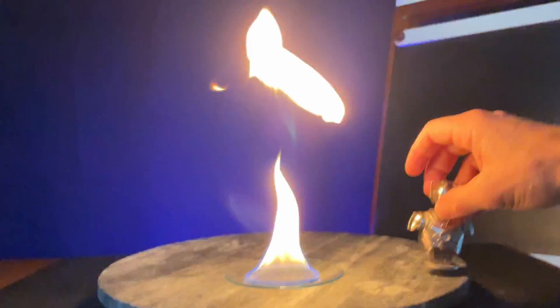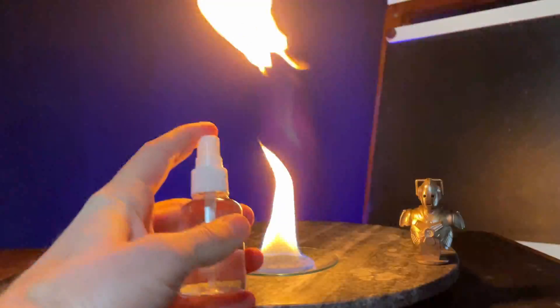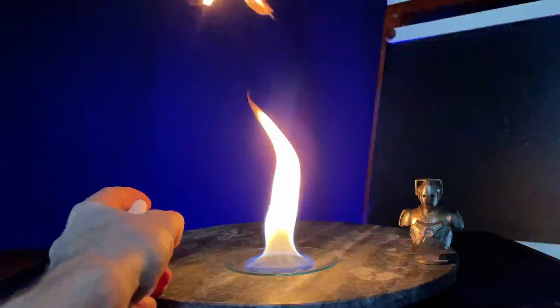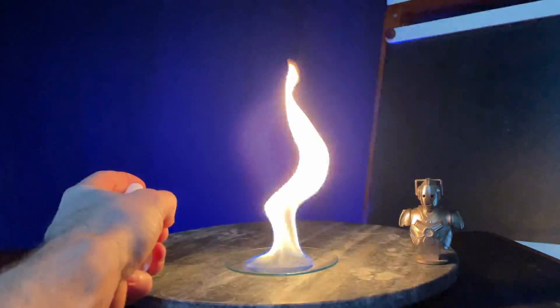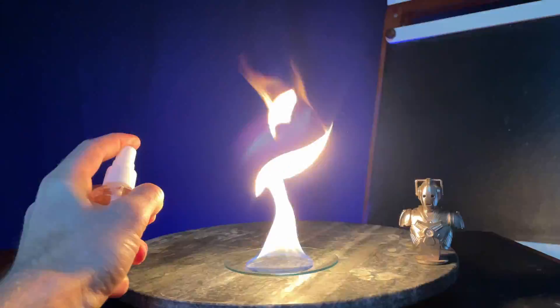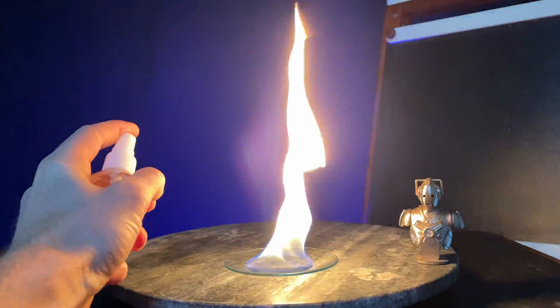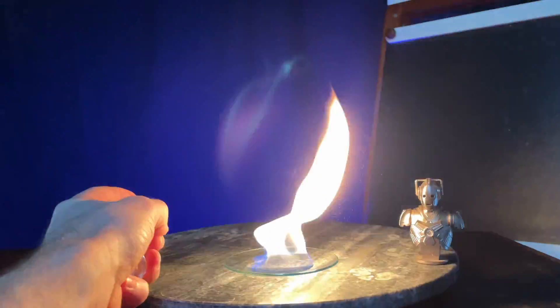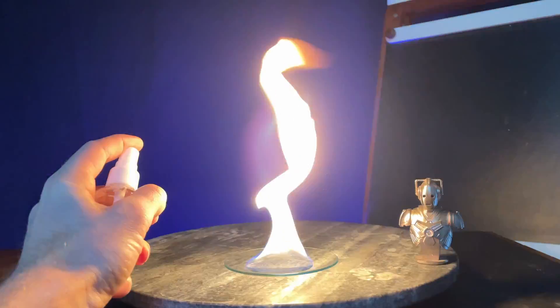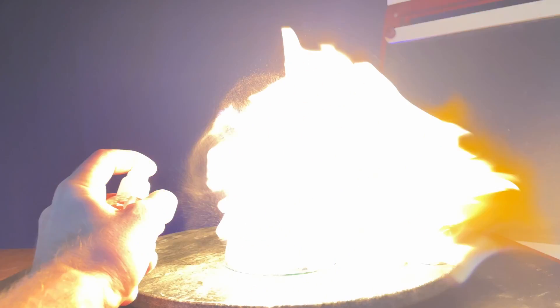I'm going to pass some very small alcohol droplets through the flame. Notice each puff has significantly less alcohol than is in the watch glass, yet a significantly larger flame is produced. Are you familiar with what accounts for this? It has to do with the ability of oxygen to bump into the alcohol.